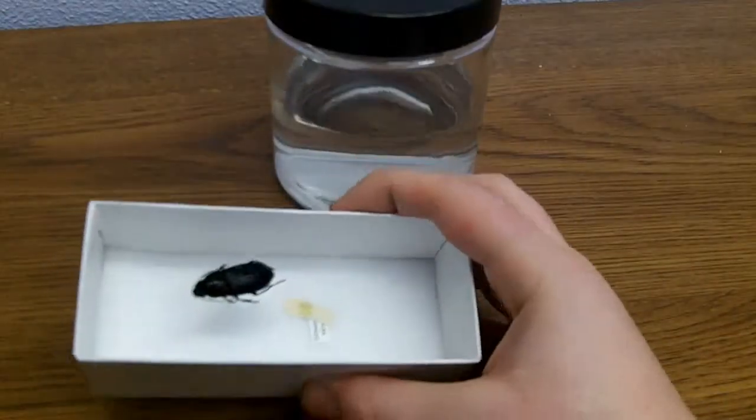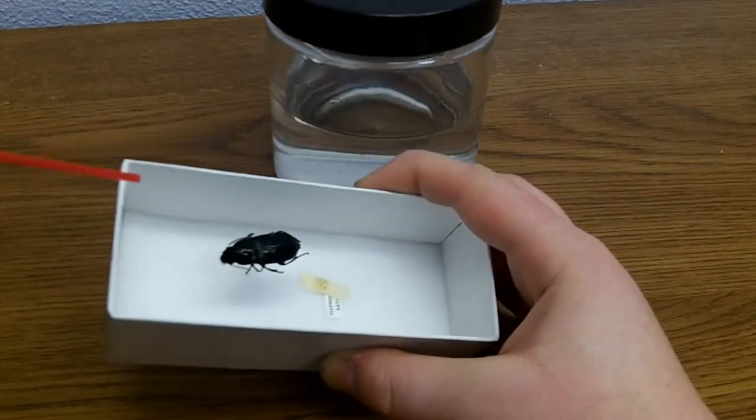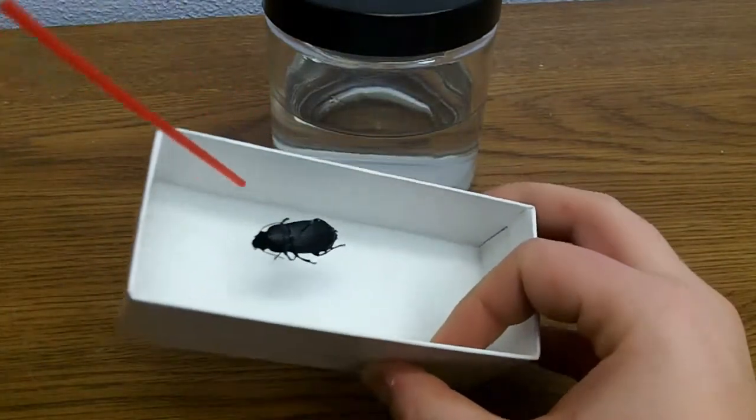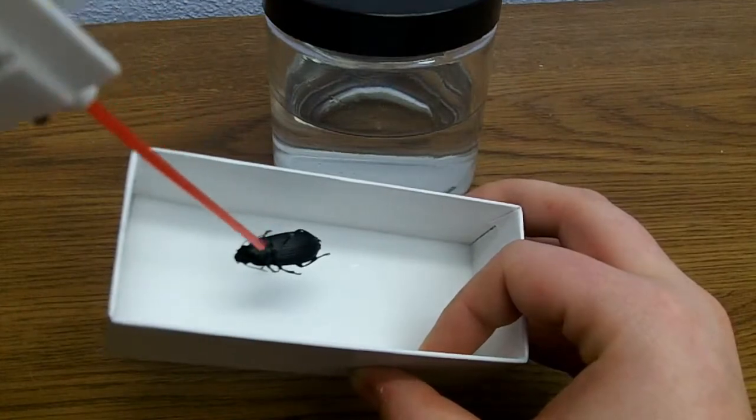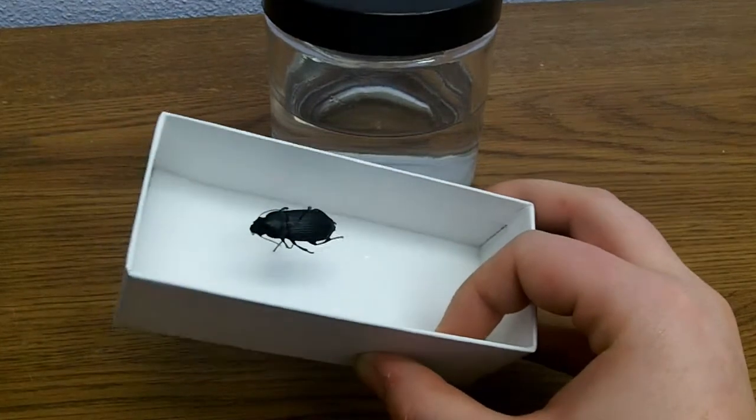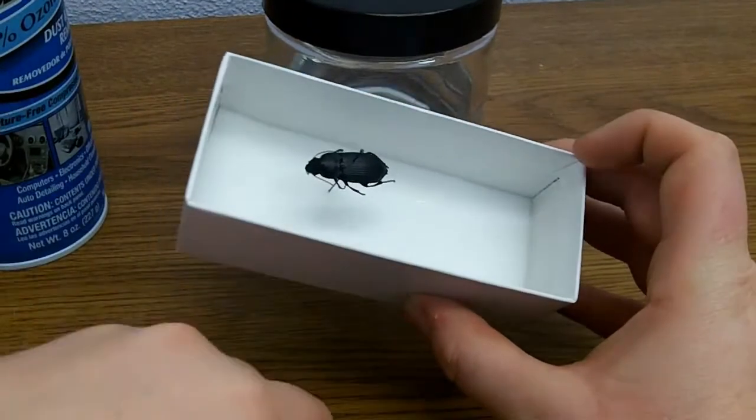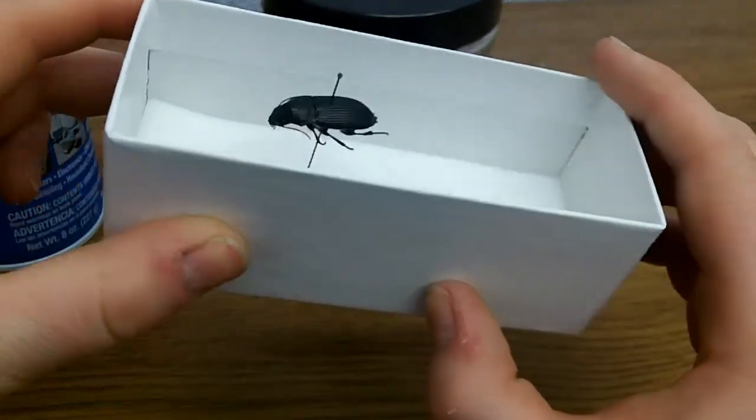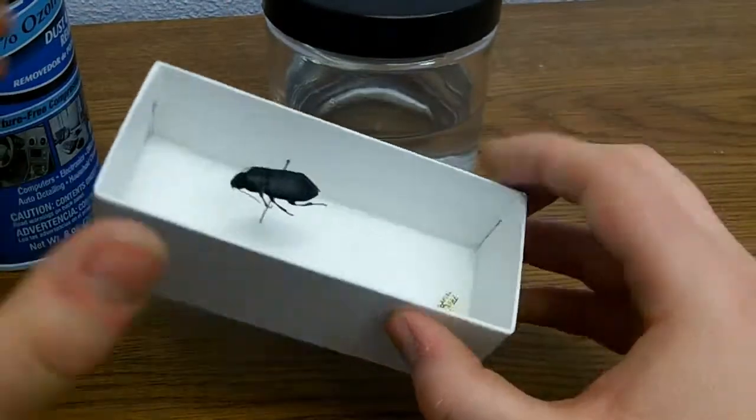What you can do to dry the specimen quicker is to use an air duster. Now the specimen can dry much quicker, and if there was anything left on, it's more likely it got blown off by the air duster.